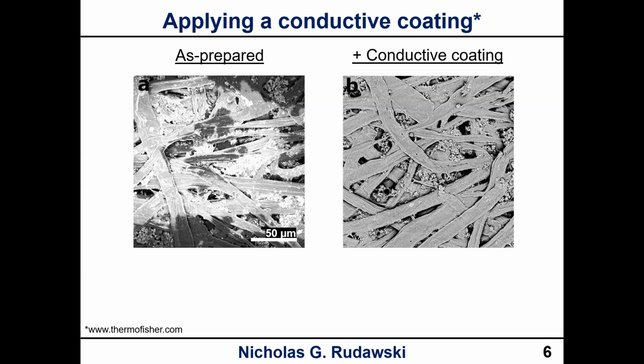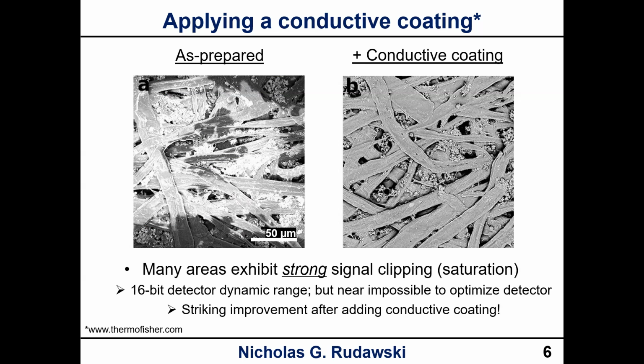But when you have a conductive coating on there to bleed off the accumulated charge, you no longer have this issue, and you can actually see the structure how it really is, okay? And that's even with a really good detector, right? Most detectors now in the SEMs are 16-bit dynamic range, which is really good, but it can still become very challenging and nearly impossible to optimize the detector so you're not seeing this saturation when you are dealing with this charging issue, okay?